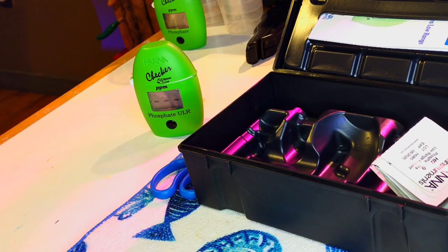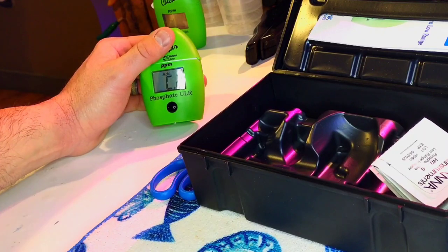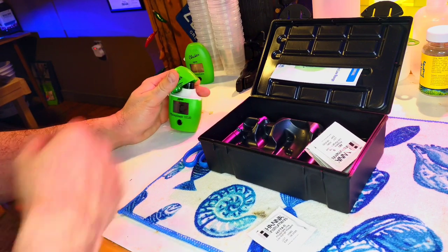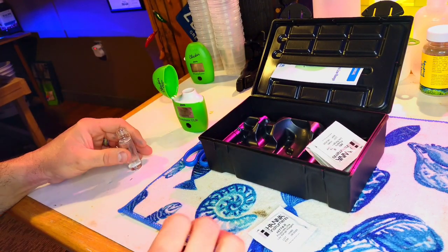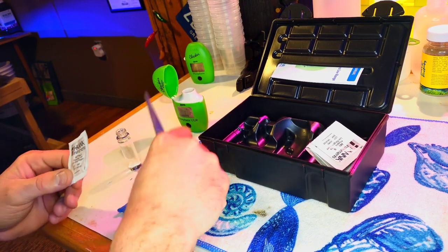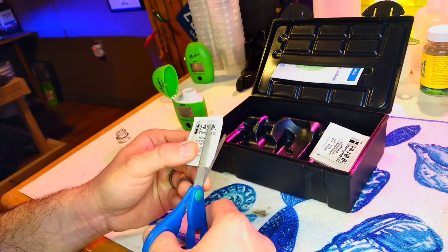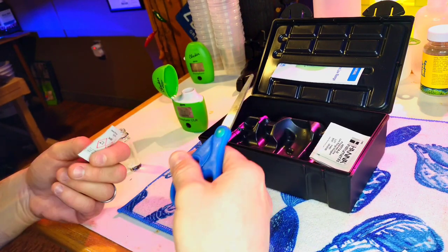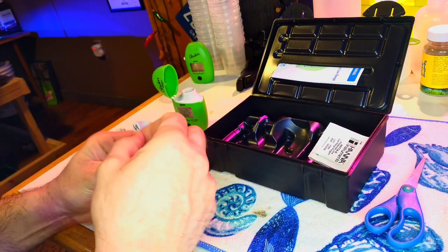For some reason, sometimes these things take that long and sometimes it seems instant. Just know that it works as long as the C2 comes up. Now we're going to put our reagent in. In the calcium tester section, I mentioned I like to keep a kid's pair of scissors in these test kits so I know I have scissors here. I have three girls — they're older teenagers now — and if I buy scissors, all hundred will disappear on me, so I keep my own in here.